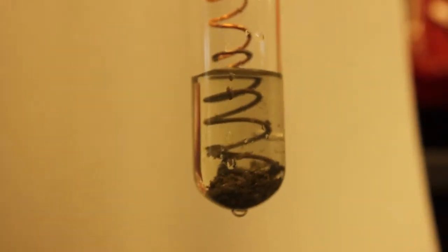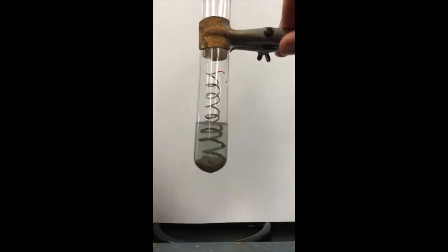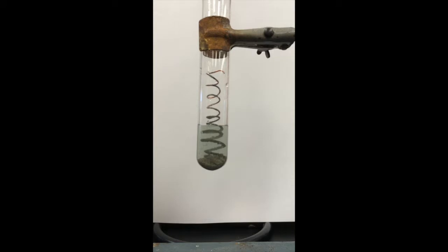Silver continued to gather as a flaky solid until the copper had fully reacted. At this time we flipped the copper over so there was more copper to react with the solution.